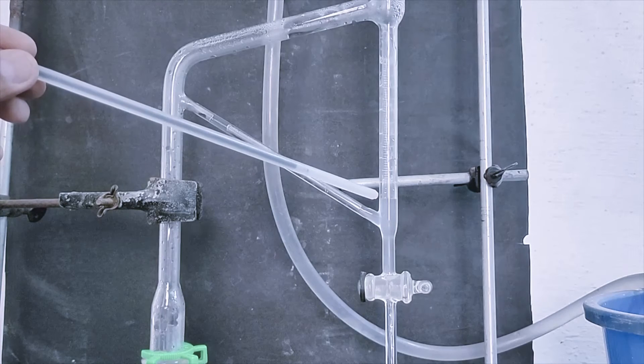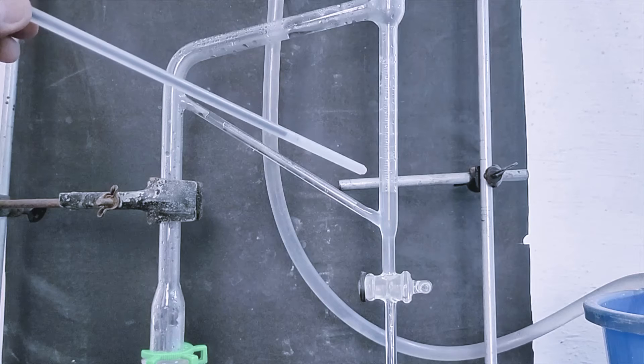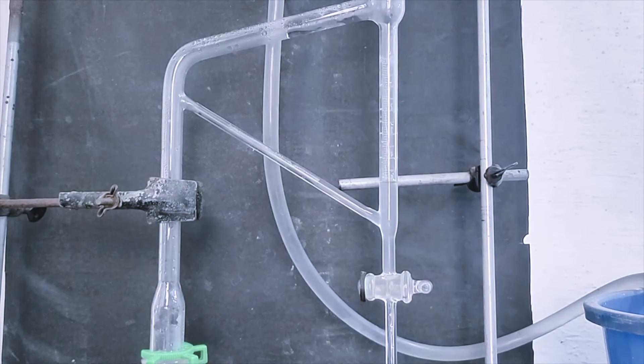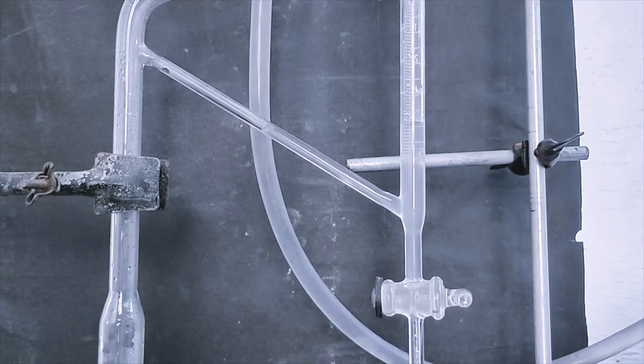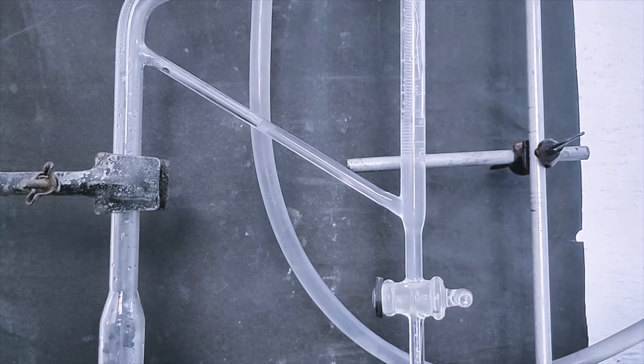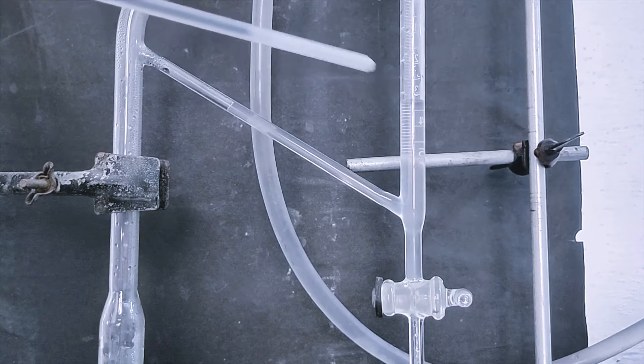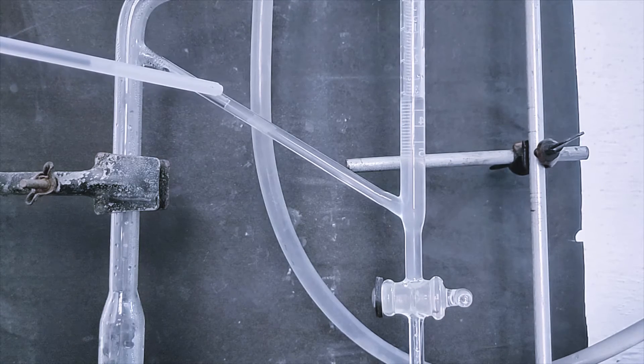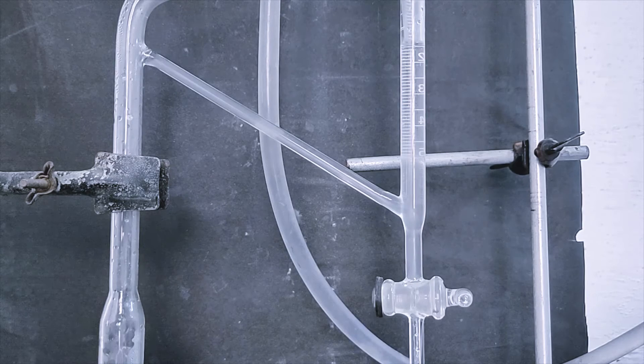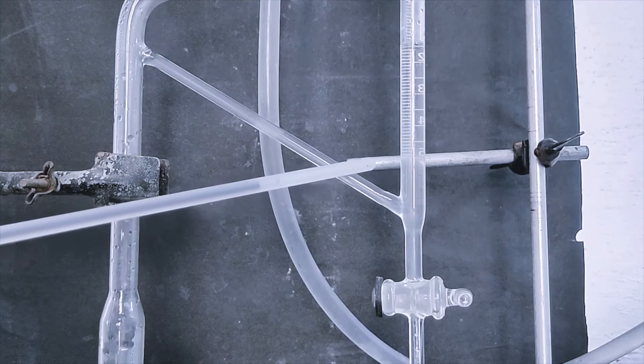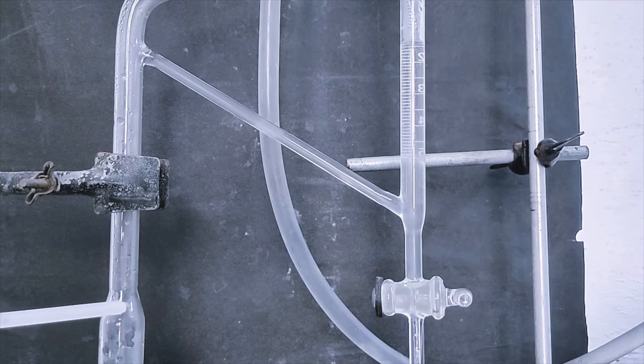Water having essential oil in the emulsion form is collecting. Water having essential oil rising up in both the tubes, vertical as well as diagonally. Now it is clear that if I am not emptying this tube, then it will fall down. It is falling down in the round bottom flask.